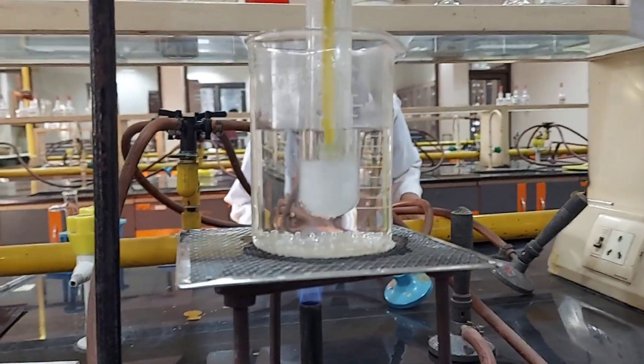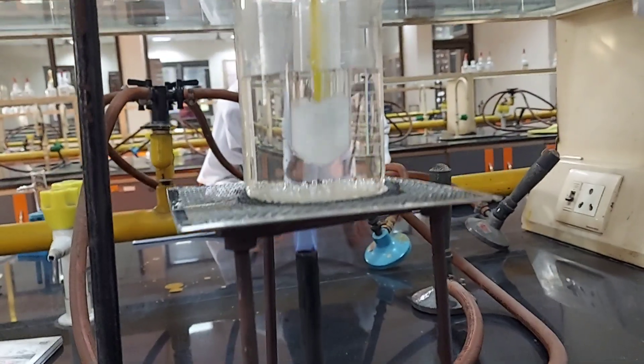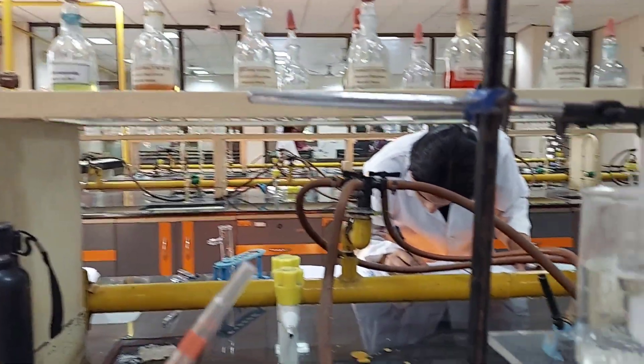Hello everyone, we are performing an experiment to determine the critical solution temperature and the corresponding critical solution composition for a phenol-water system. The procedure for this experiment is very simple. We weigh three grams of phenol in a dry, clean boiling tube.